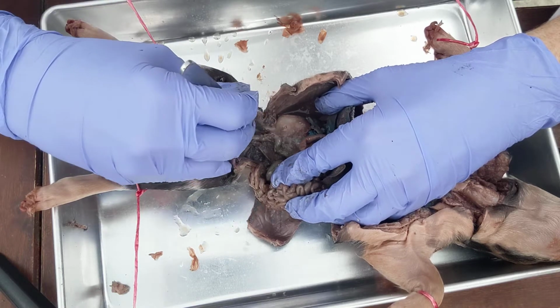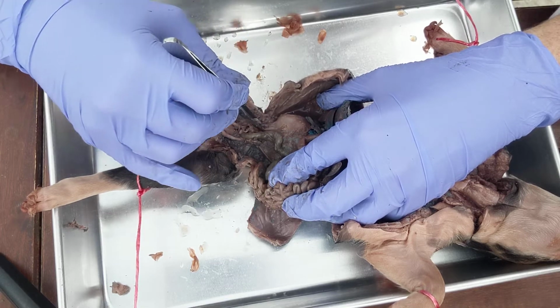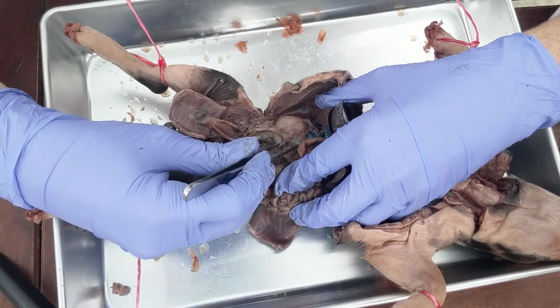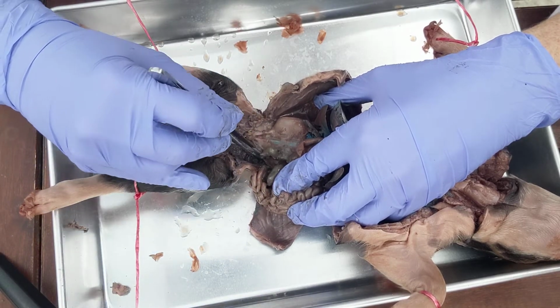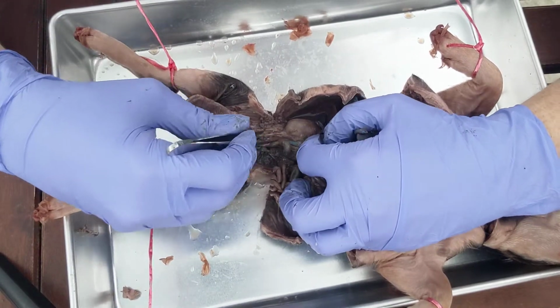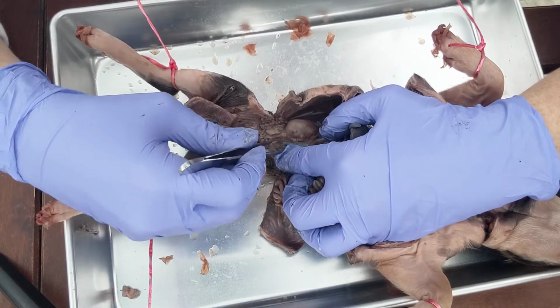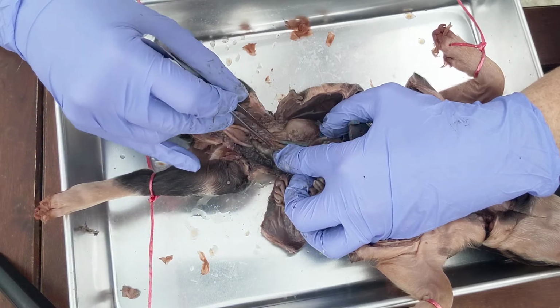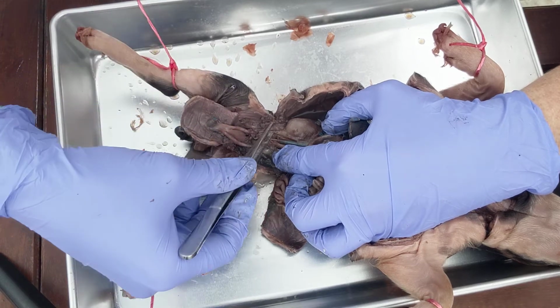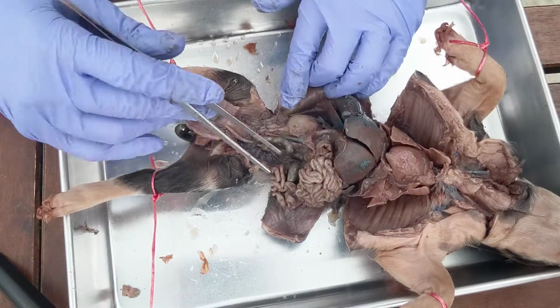So put that to the side. Now coming off of the kidney, we have the ureter. The ureter is very soft. Okay, and then we can also find the blood vessels in here as well. So let's move that large intestine off to the side. Again, blue for veins, so the blue one would be the inferior vena cava, and then the pinker one next to it would be the abdominal aorta. So inferior vena cava, abdominal aorta, very soft ureter coming directly off of the kidney there.